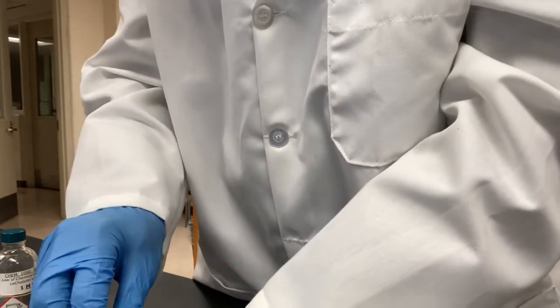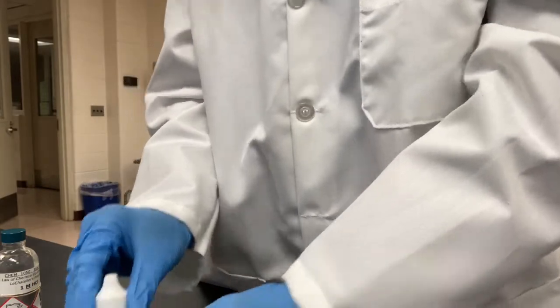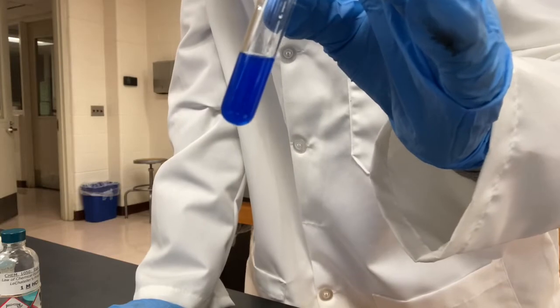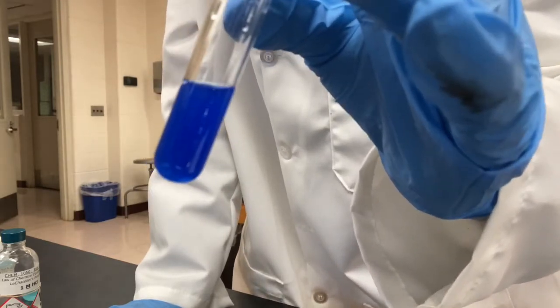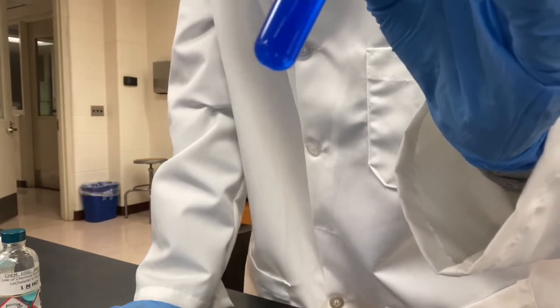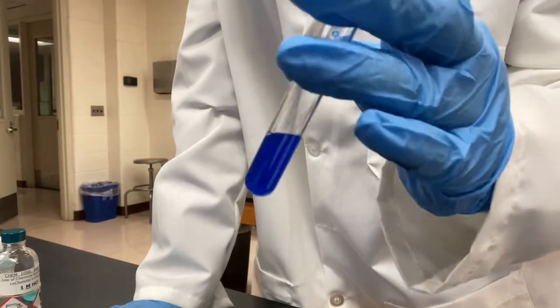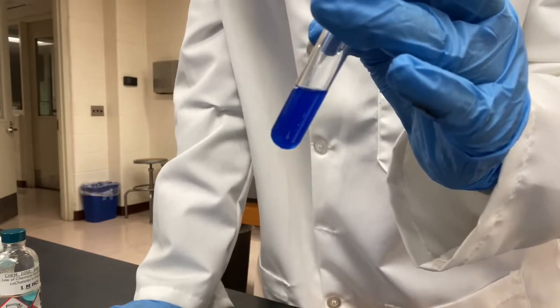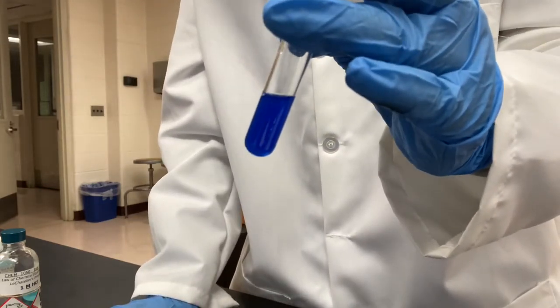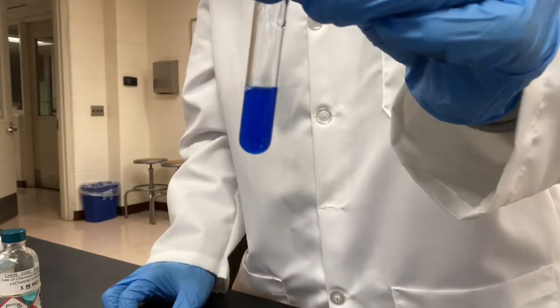Now, we're gonna add, well, before we add anything, on the lab report, it asks you to predict how the equilibrium shifted when the ammonia is added. The equilibrium we're talking about is the one I just showed you guys, okay? The copper with ammonia, that equilibrium. It is also in your lab manual, okay? You just answer whether it's shifted to the left or to the right.